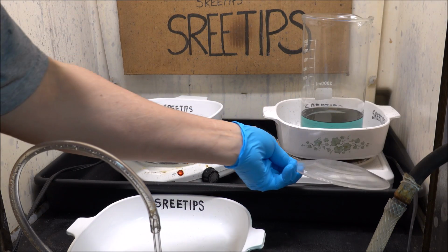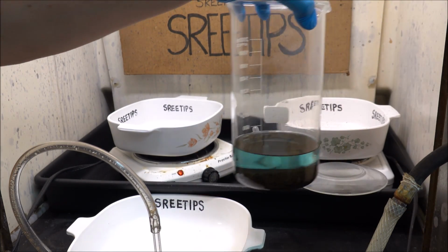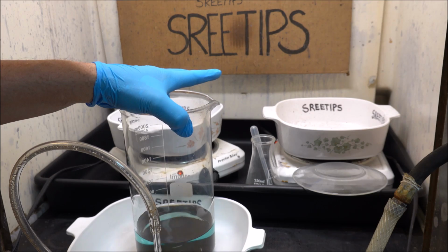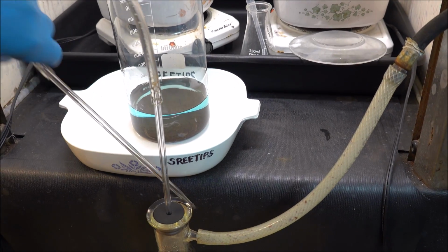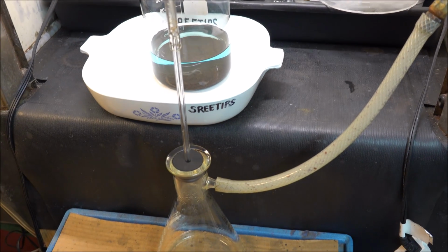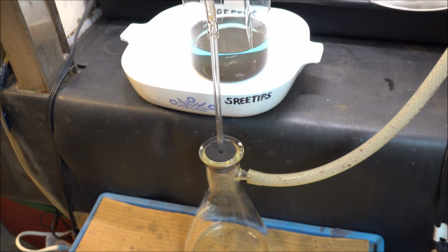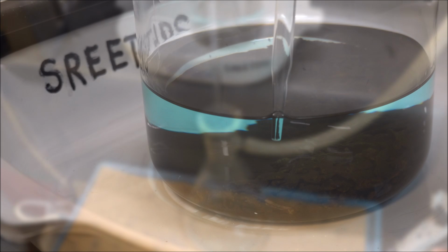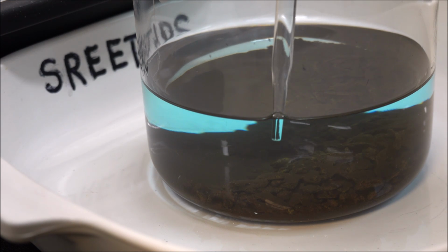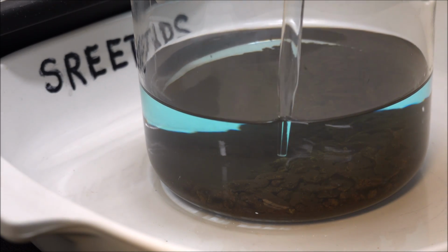Okay, here we go. This beaker here is the subject of this video. It contains inquarted gold that had the improper amount of silver added. I added too much silver, and as a result, when I put the hot dilute nitric acid on it, the gold, instead of staying in nice firm chunks, as you've seen in previous videos, it caused the gold to crumble, come apart in pieces, and form a powder.